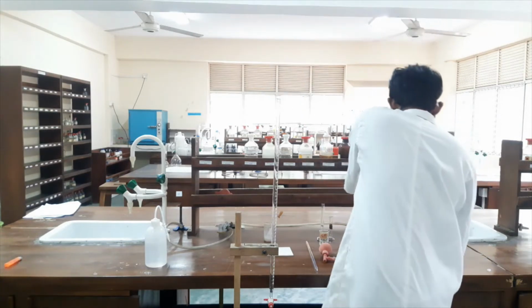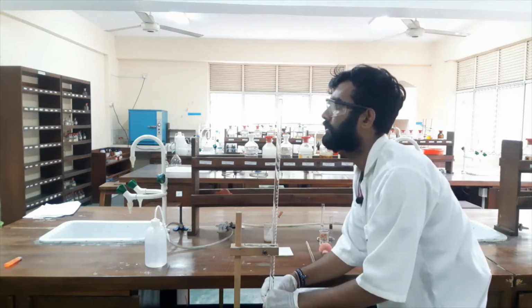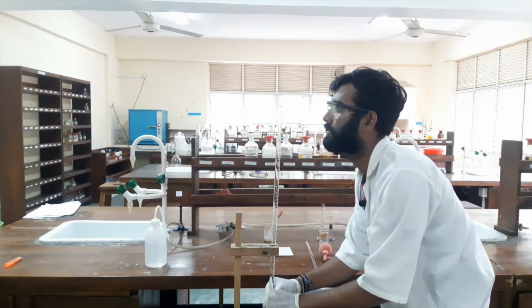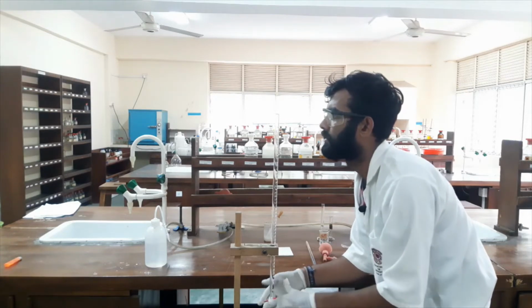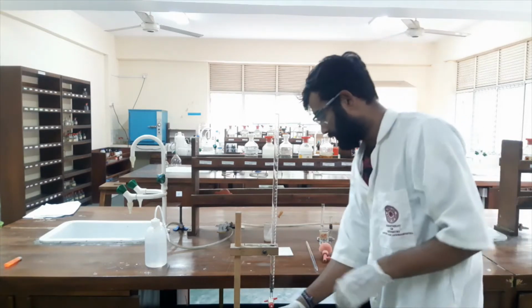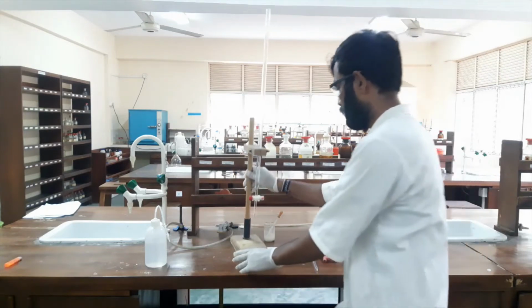Okay. Now I will adjust the meniscus. Okay. Now it's very precise. Now it's 0.